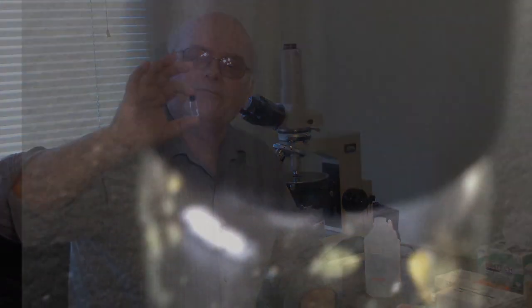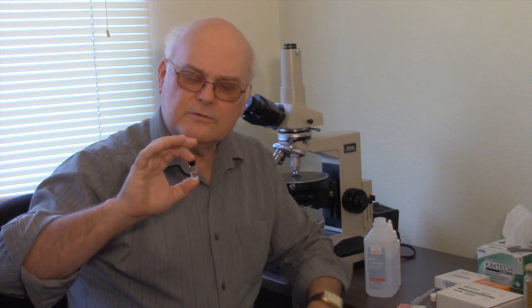We can simply shake the vial and distribute pollen through the alcohol. We'll have to shake it for a bit to see the grain break down and distribute individual pollen grains through the alcohol.